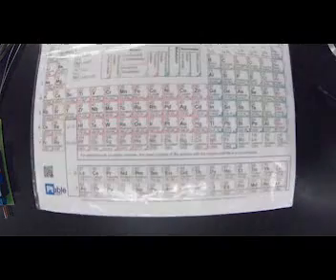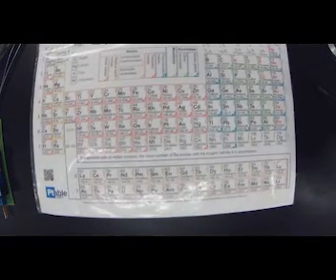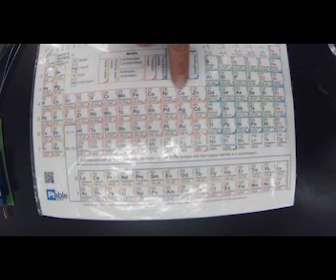Again, I'm going to clean off my paper so I don't have contamination in case I need it. It is copper. Is it a metal? So, copper is in here. As soon as Miss Z finds it, there it is, number 29. And it is a transition metal. So we should see all those properties of a metal.